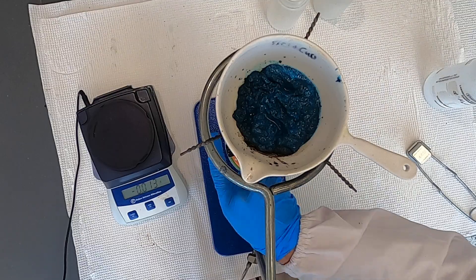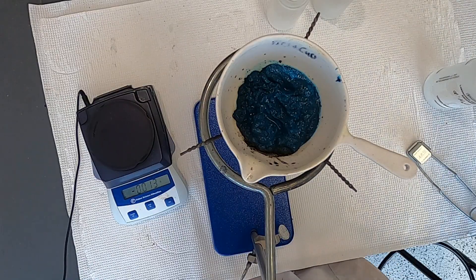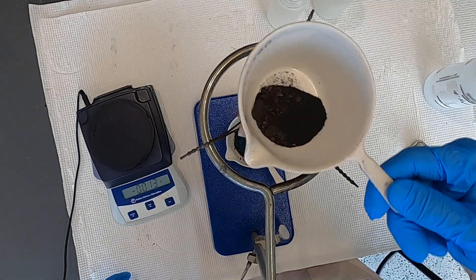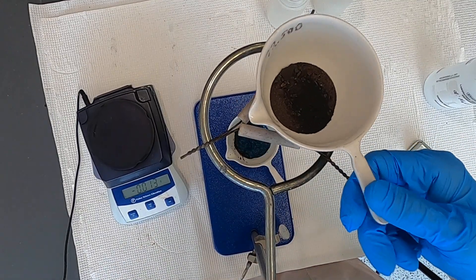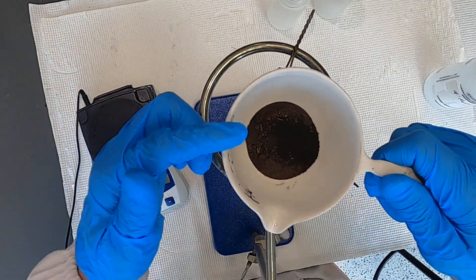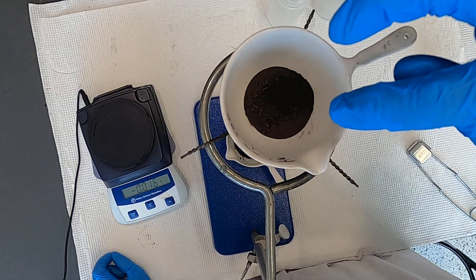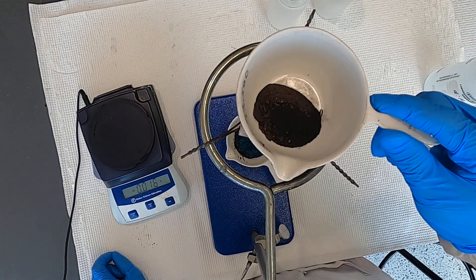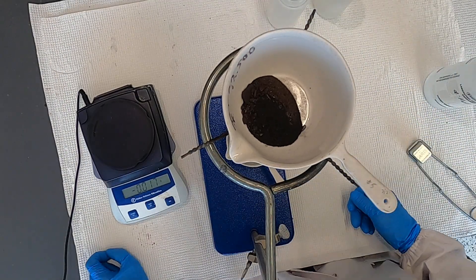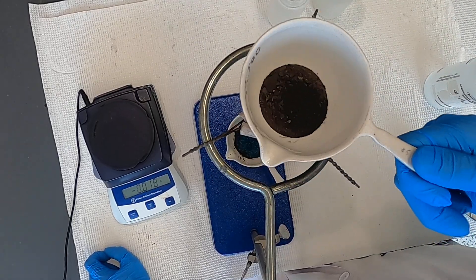To save a little bit of time, I'm going to stop the flame and show you one I already did — and this is what it looks like. We've got our nice dry copper oxide. We have the mass of the crucible from before, and the gross weight of the crucible plus the copper oxide. Take the difference and that's the mass of the copper oxide, and you can work through the laboratory to get your empirical formula. This is what the product looks like at the end.